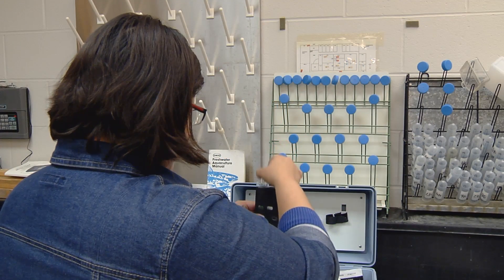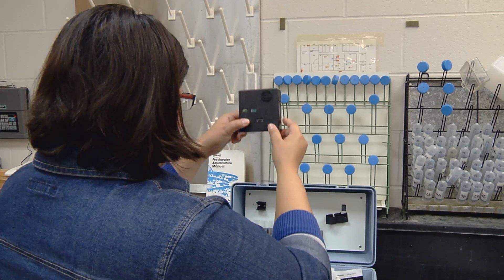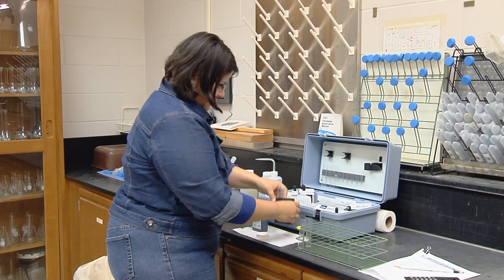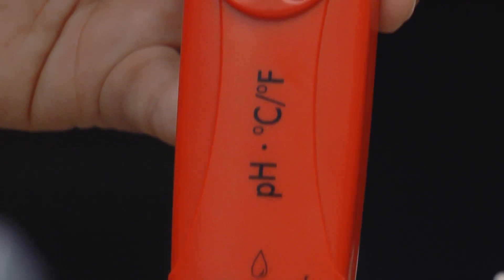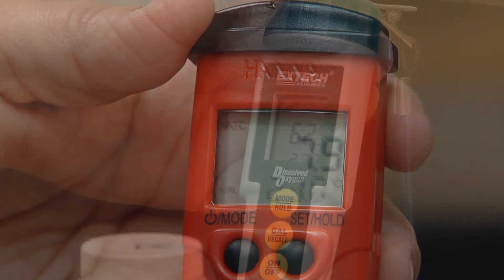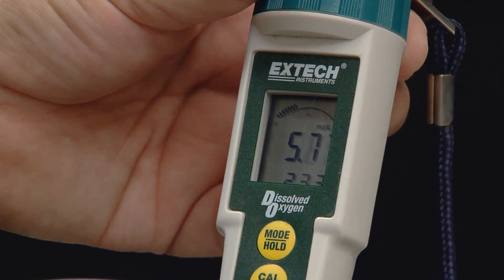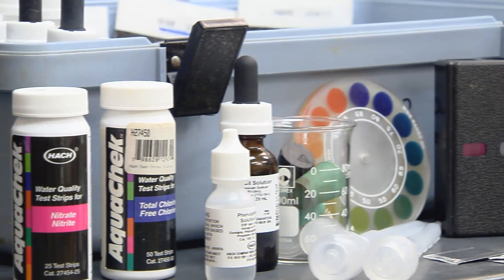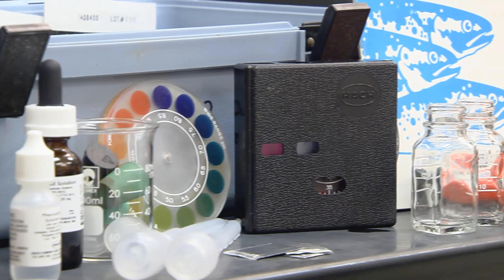A variety of methods are available to monitor water quality. In pond, cage, and low intensity culture, the high precision of sophisticated analytical methods is not needed to make informed management decisions. However, intensive culture and recirculating and reuse systems requires frequent and sophisticated monitoring. Several suppliers produce kits and materials to monitor water quality. Easy-to-use water quality test kits cost approximately $100 to $500.